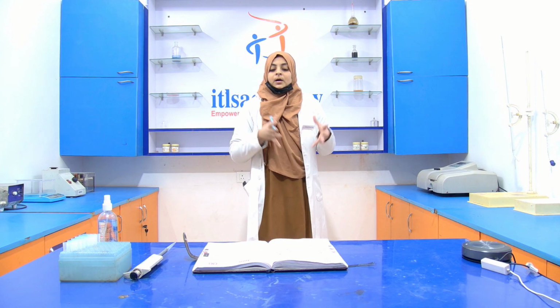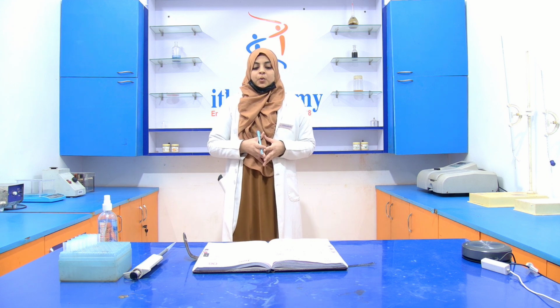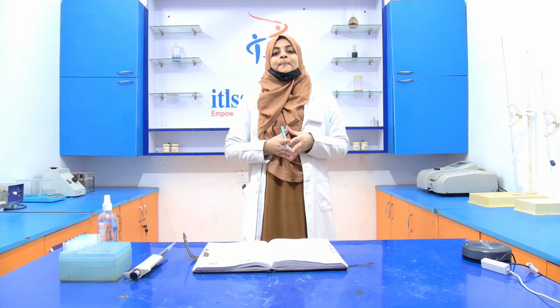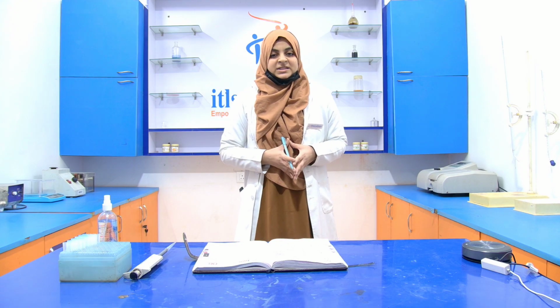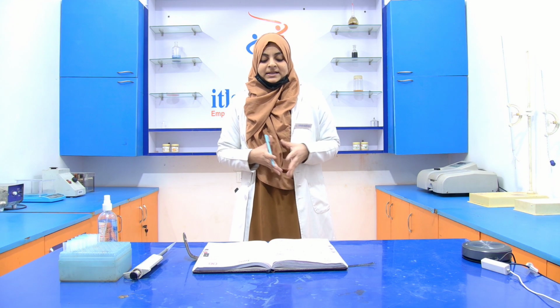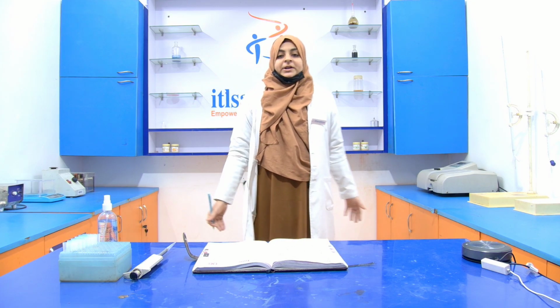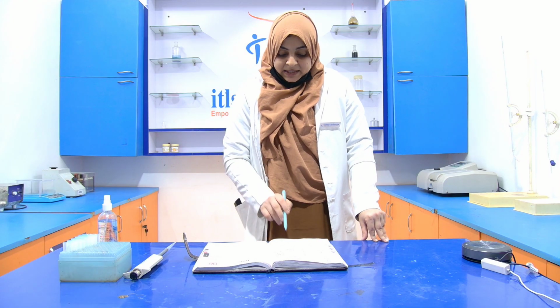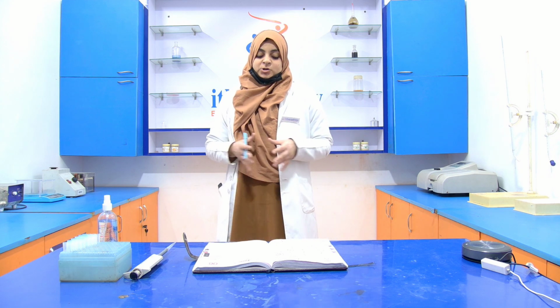Now, after putting the values of the absorbance and the concentration of the BSA into the graph, we get the slope by using the formula, that is A2 minus A1 divided by C2 minus C1. A1 and A2 are the absorbance values and C2 and C1 are the concentrations of the BSA. Now simply when we put it into the formula, we get the slope that is around 0.140. This is the slope.